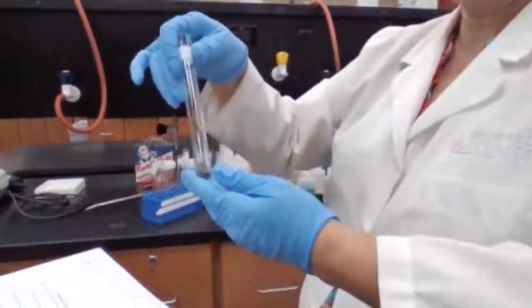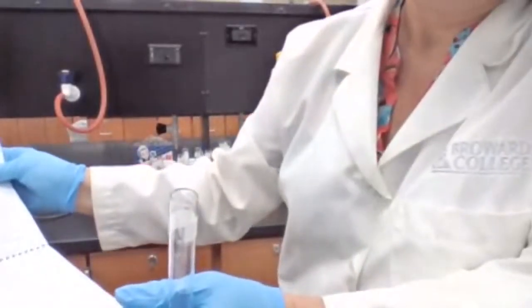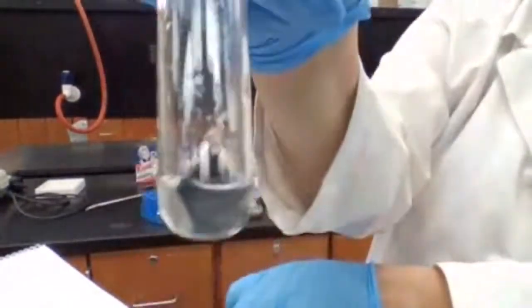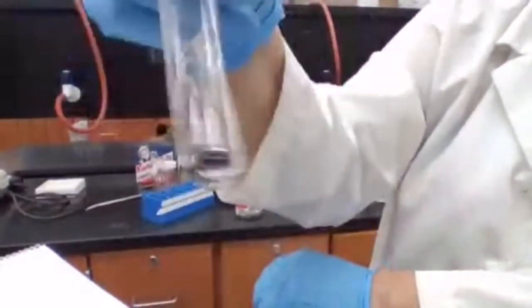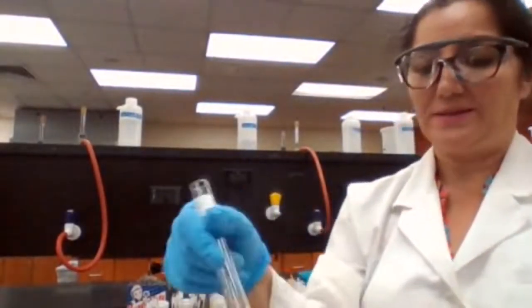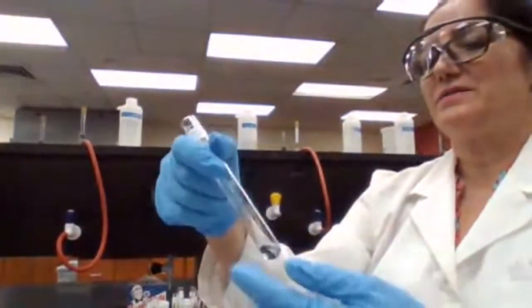For test tube D, zinc is added to lead nitrate. Zinc reacted with the lead nitrate — zinc is going in and lead is coming out. You can see the particles on the wall of the test tube. Zinc reacted with lead nitrate as well, which means zinc is more reactive than lead. Zinc can give electrons to lead. This is essentially an oxidation-reduction reaction — zinc is being oxidized and lead is being reduced.